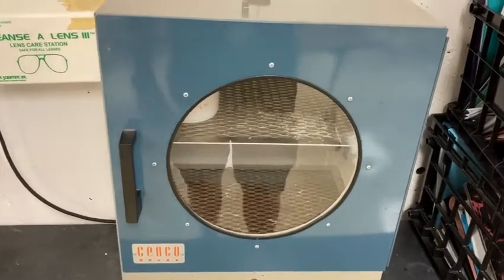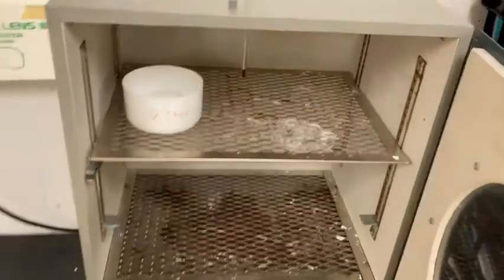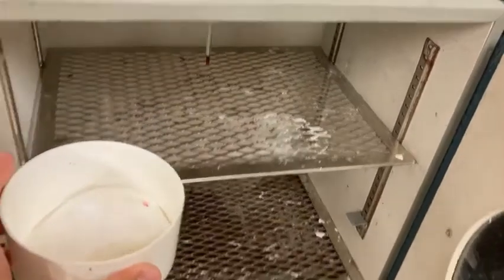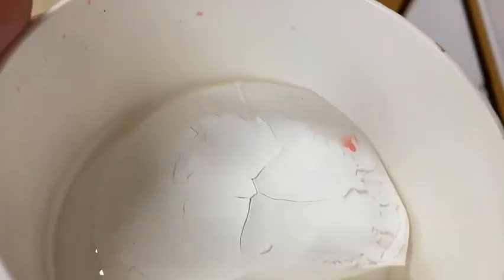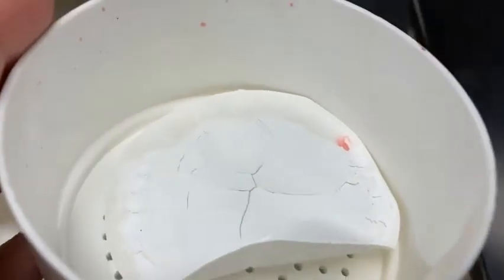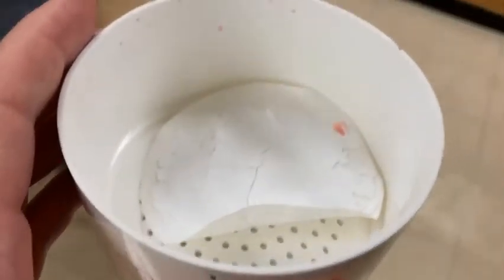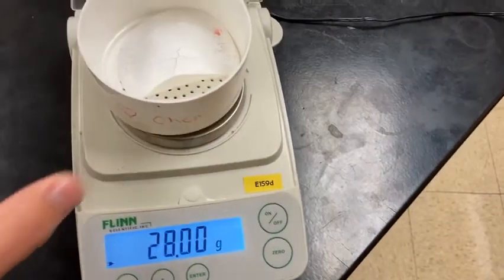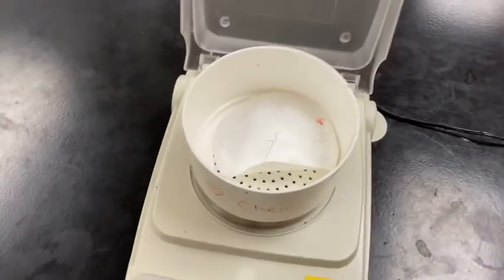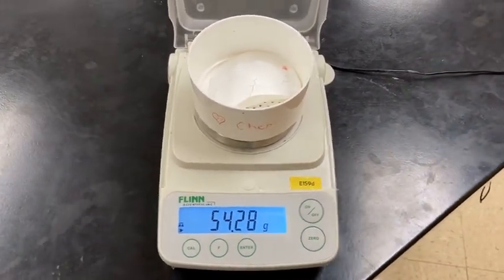And through the magic of video again, it has been sitting in the oven. Let's open it up and see what we got. Take a look at that precipitate. The solid is kind of cracked up, crystalline structures coming in place. Looks pretty dry. Hopefully it's dry. If not, I'll let you think about what it not being dry would do to the results here. And let's measure it. I am measuring this precipitate with the filter paper and the Buchner funnel lid. And here's our final mass.